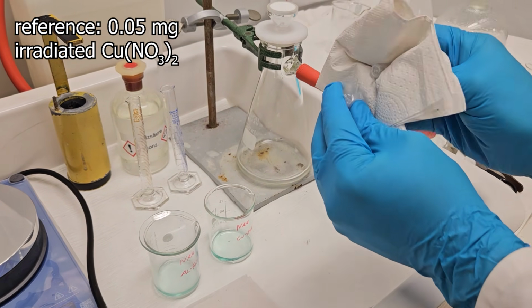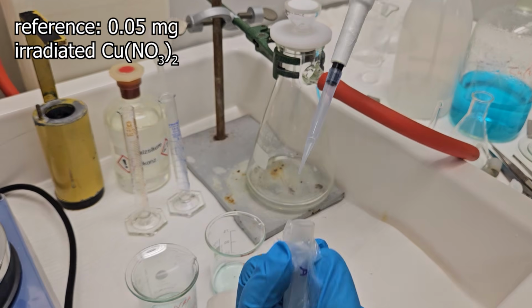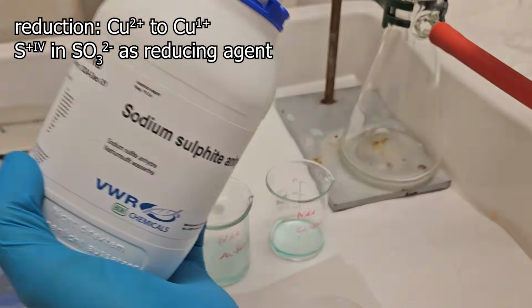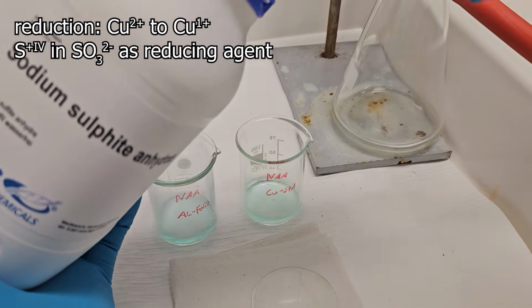I mentioned a copper standard earlier. This also has been irradiated and it will serve as our reference. This is also added to the other beaker. Both beakers now contain radionuclides. Our aim is now to end up with a copper 1 thiocyanate precipitation.